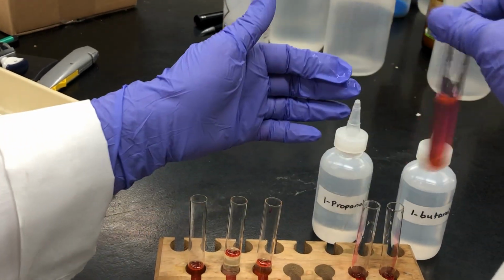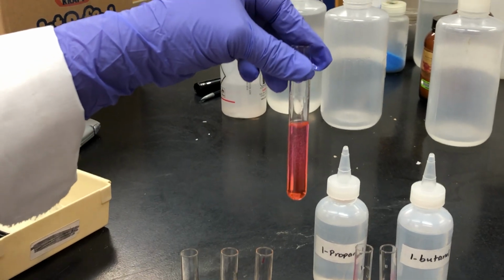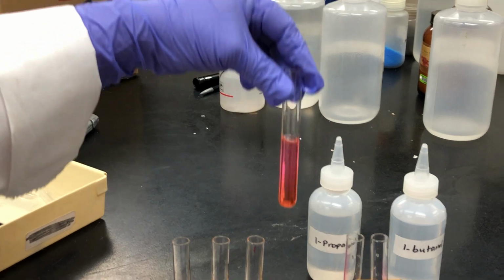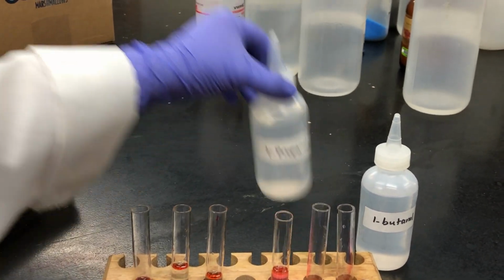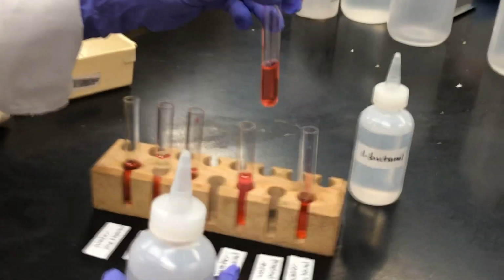It takes a little more shaking than before, but the liquids are clearly mixing. It's all a nice even color, it's all pink, and that implies that the liquids mix. The liquids mix, and of course the food coloring goes into the mixture.